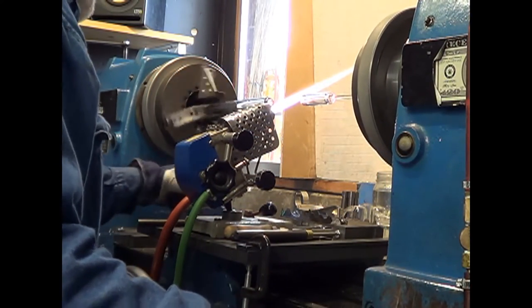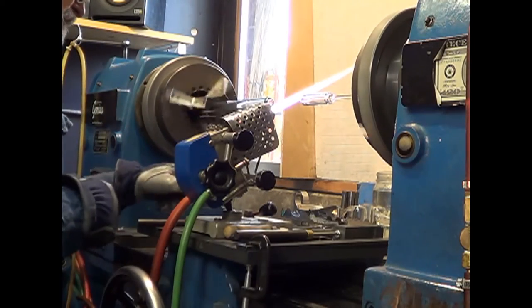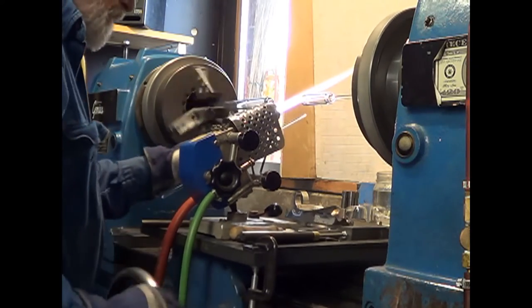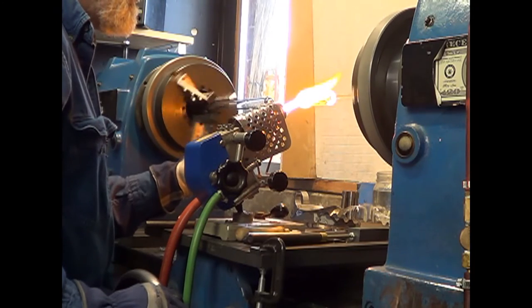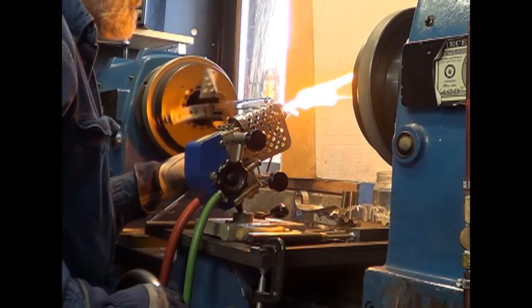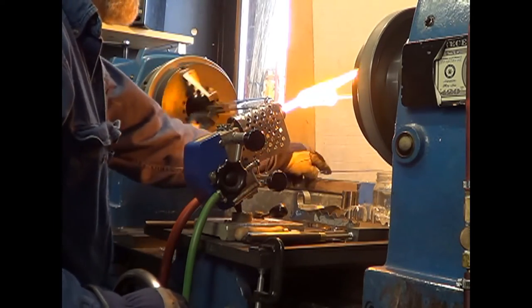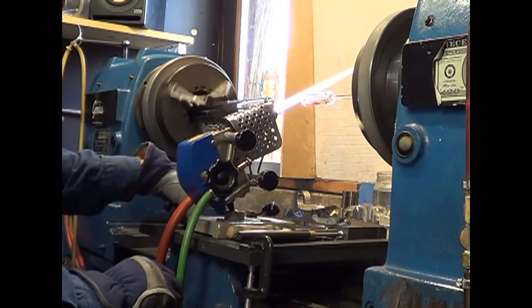The side on the right has been closed off, so it's going to create a vacuum and could create a problem. So I'm taking a small, solid rod, and I'm going to open that end, gather up some glass, and then I'm going to quench it in water — tap the end of it in that jar of water — so that it's ready for the next one.